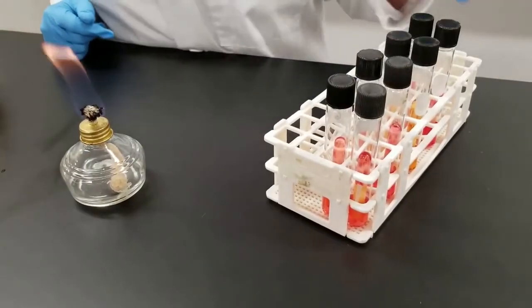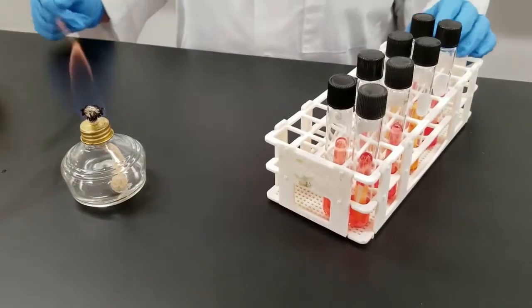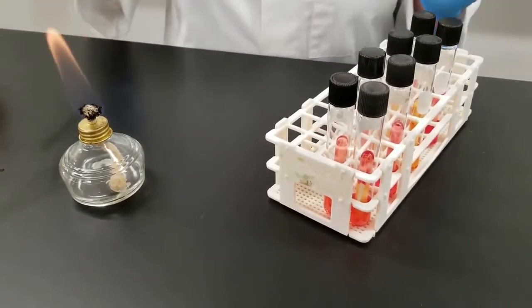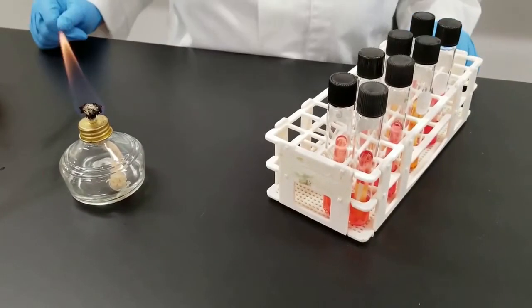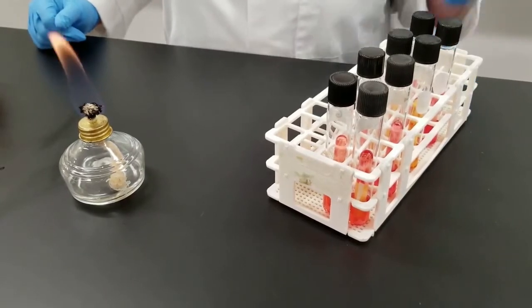So in this experiment we are going to be looking at carbohydrate fermentation or essentially the usage of sugars by different organisms.